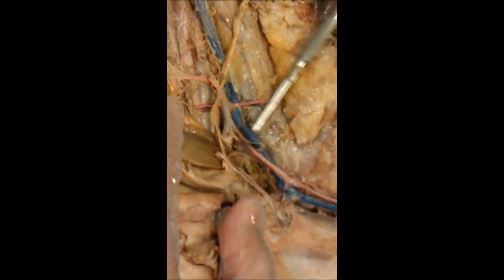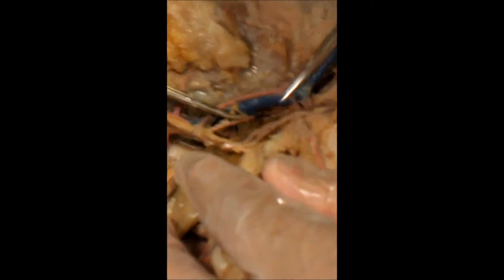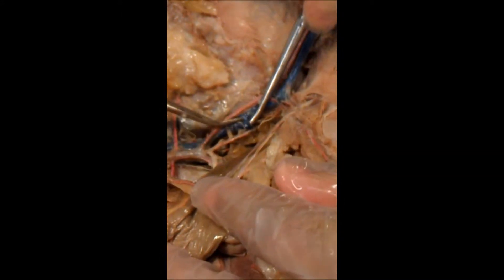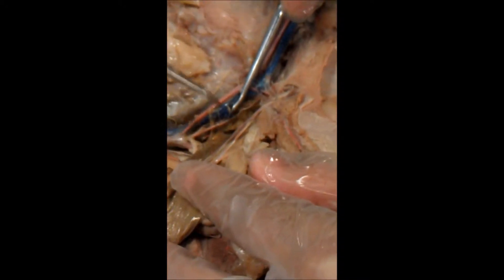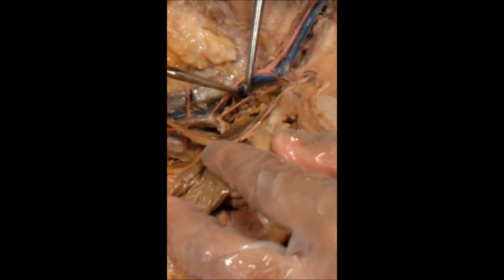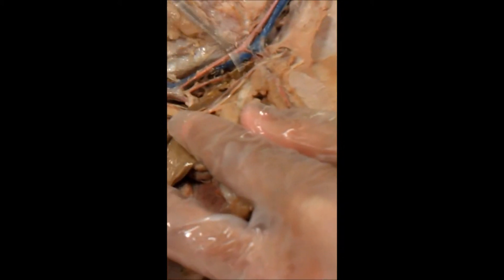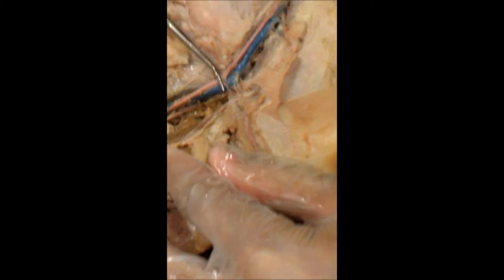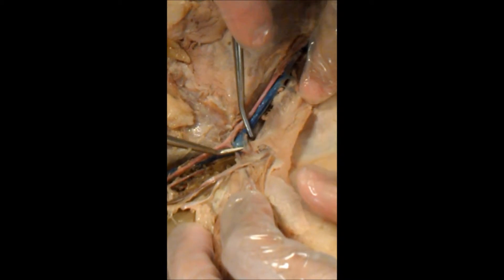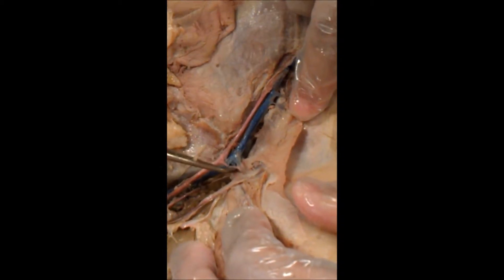This is the common iliac vein. And then more medial, you have the internal iliac vein. So you have the common one on the lateral side, and if you go more medial down in here, you have the internal iliac vein. This tiny little stretch right here is the external iliac vein. And then what's left is the femoral vein. Also, branched off the femoral more medial is the deep femoral vein.